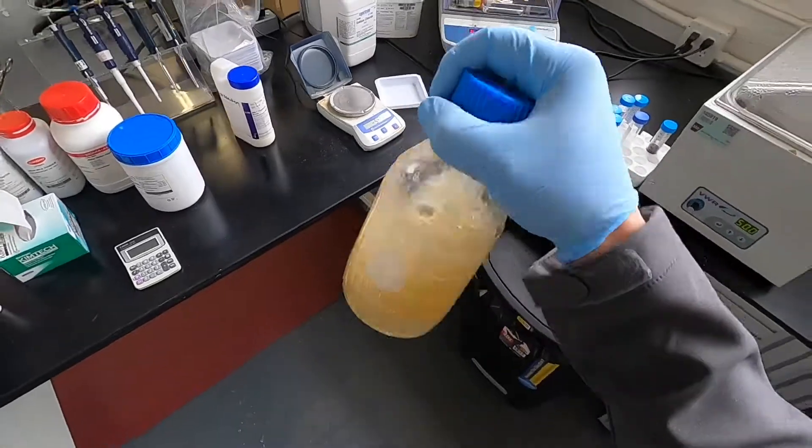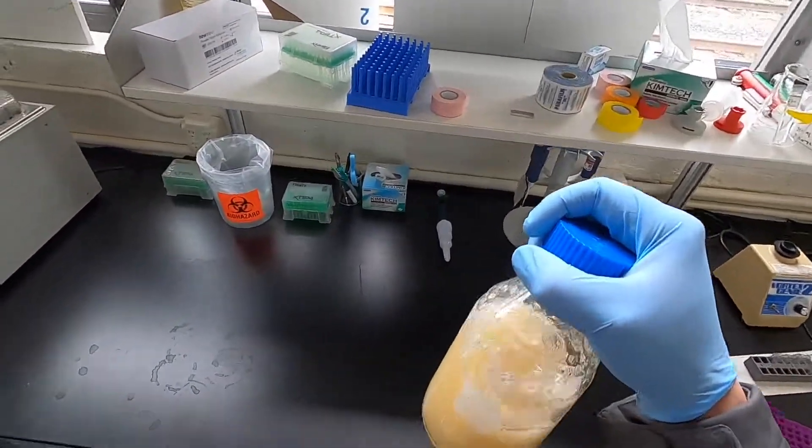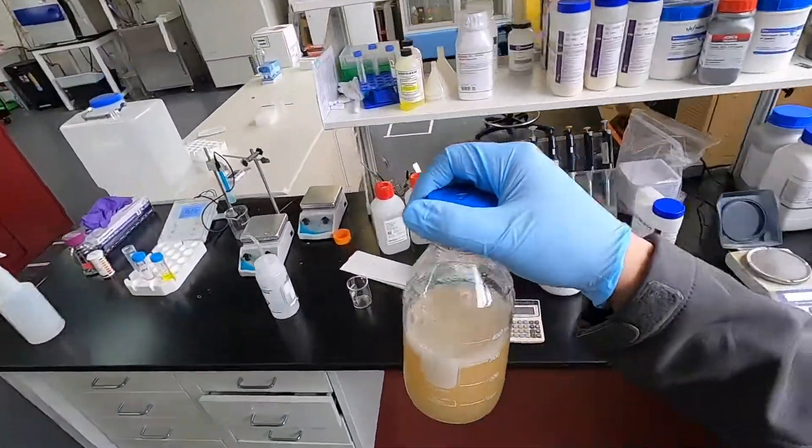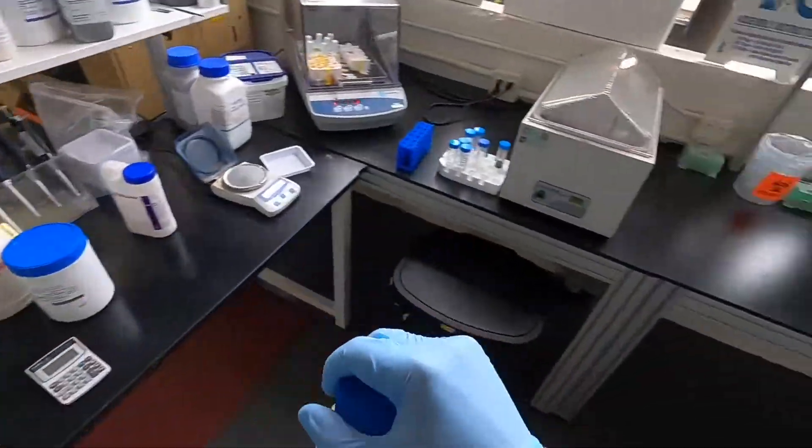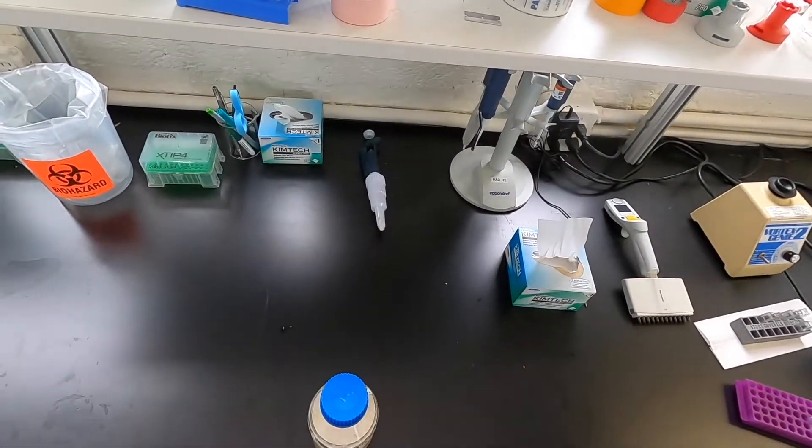I have made probably thousands and thousands of liters. Sometimes if I have patience I'll put a stir bar in and I'll preheat and pre-mix this, but I've never had an issue before just going directly into the autoclave.